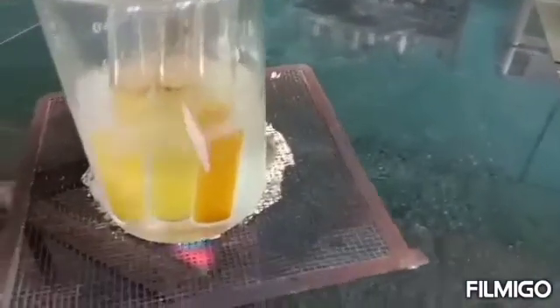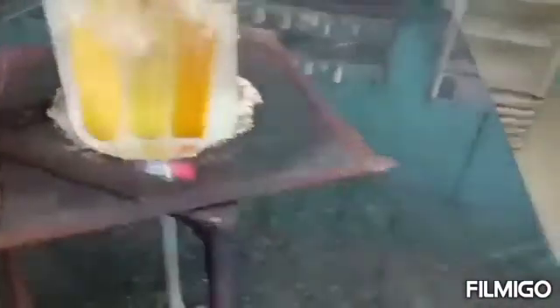Glucose and fructose also develop crystals within 5 minutes. Fructose develops first, followed by glucose. We are not using fructose here.